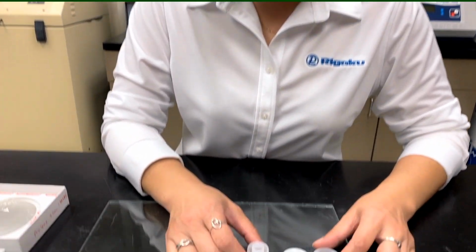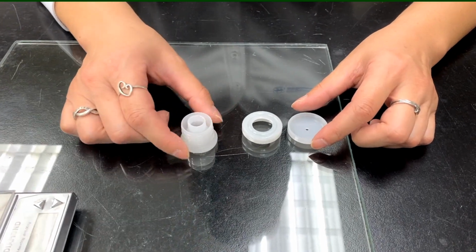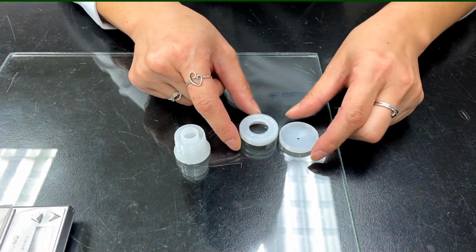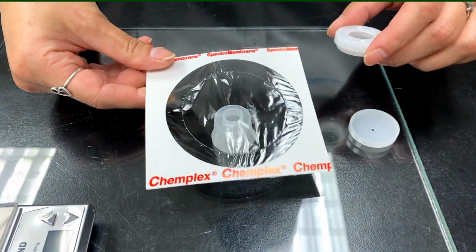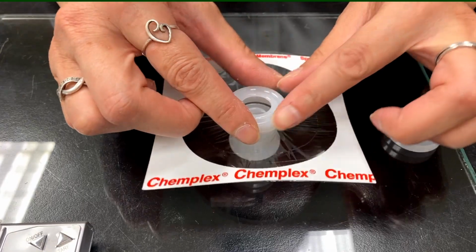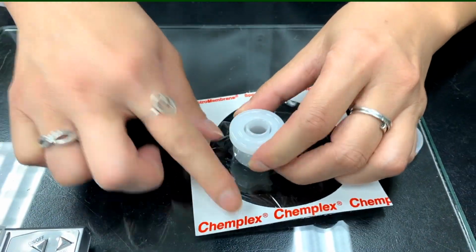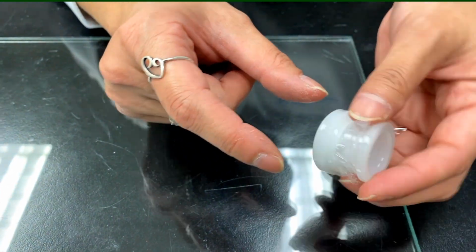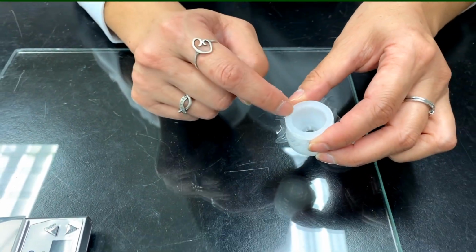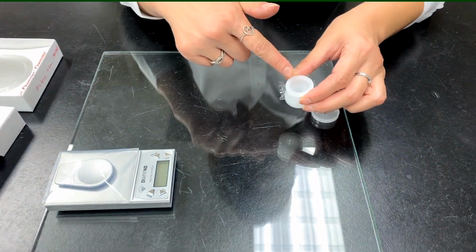Right. All right, so here's another way to prepare a loose powder in a cup for a residual analysis without pressing it as a pellet, like what we've seen before. So what I have here is a funnel type cup with the bottom of the cup and the cap. To prepare the cup, we would just put any kind of film that you have, press the bottom of it to the cup, and now you see that it could be easily used to put the sample in. And you can see that it is a funnel type cup, so it will just funnel the powder down.